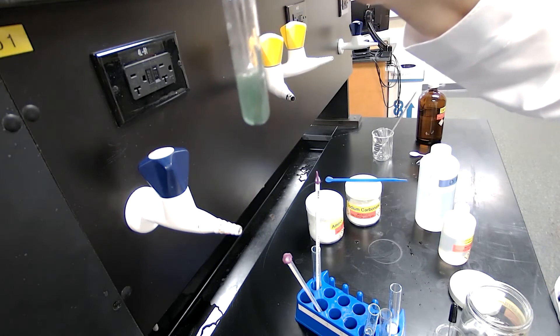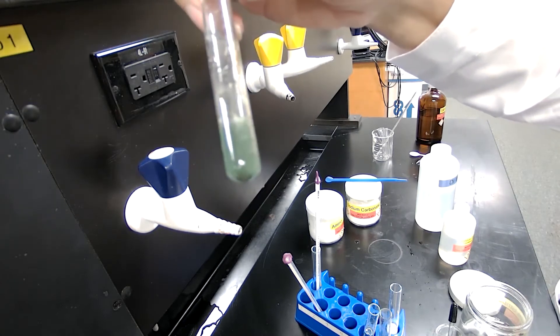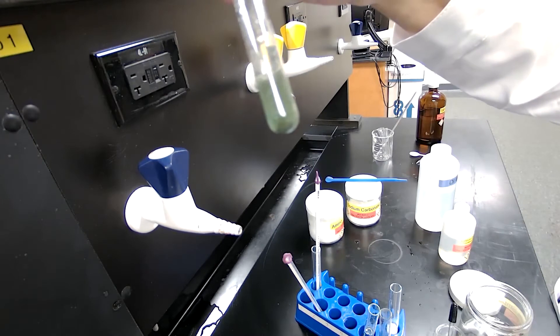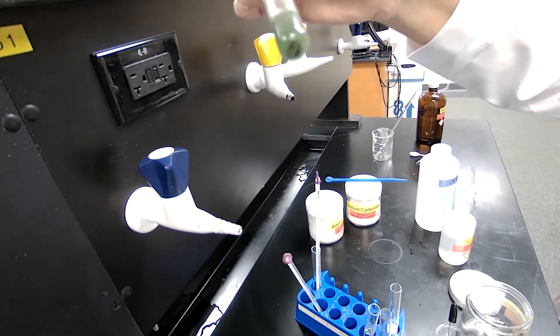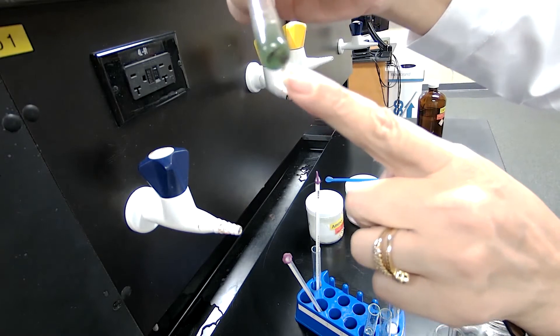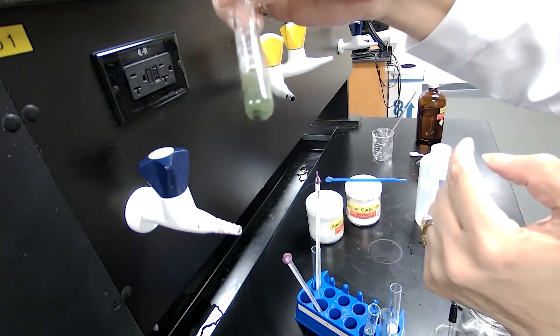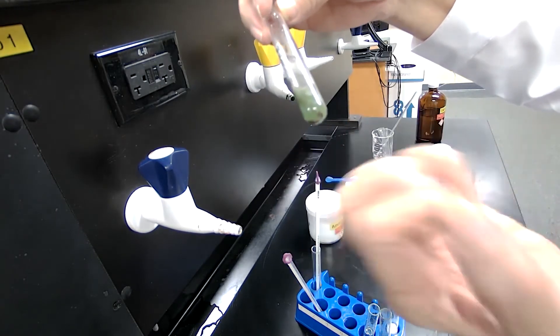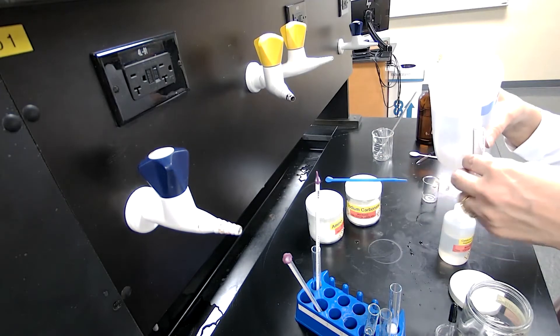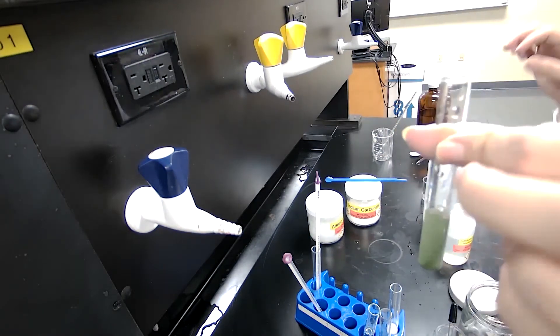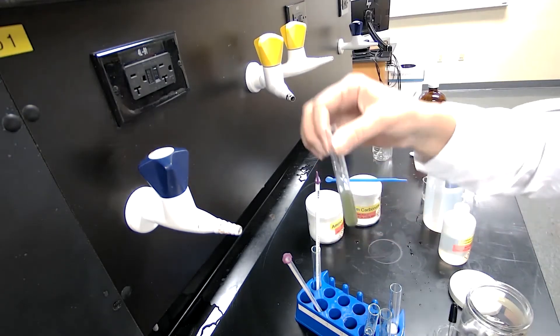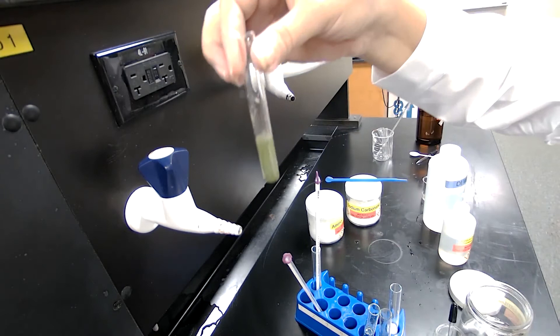Even if you don't see the copper coming out, you will see that the blue color would disappear because the magnesium, when it goes to solution, doesn't give blue color. It's going to be colorless. So the reddish brown particles that are forming at the bottom of the test tube, these are the copper coming out of the solution. Magnesium is going in, copper is coming out, the color is changing. The blue color would disappear and we get that colorless solution eventually. I'm going to leave it in a test tube rack and I will show you after I'm done with part four of the experiment.